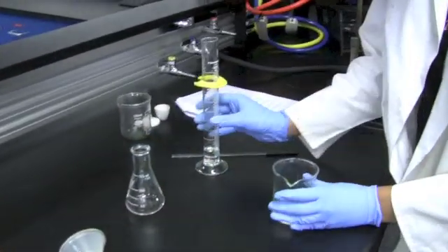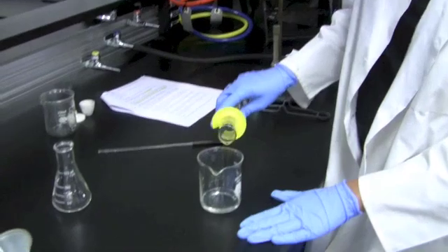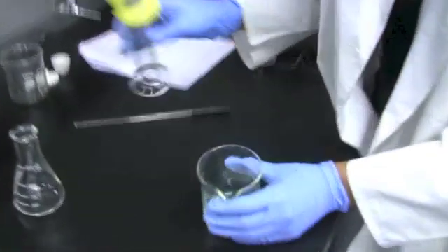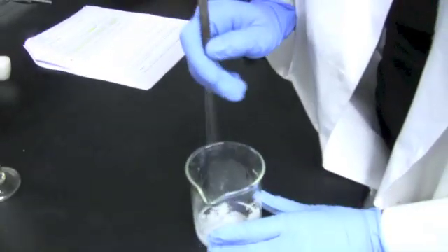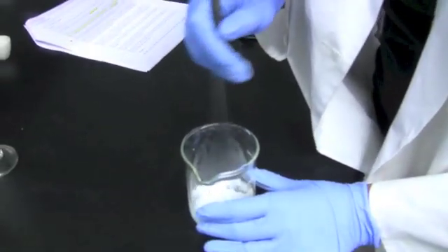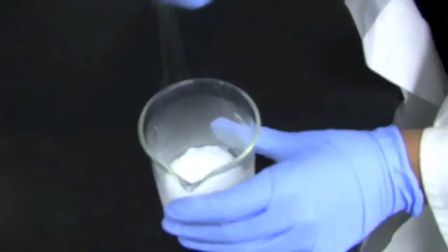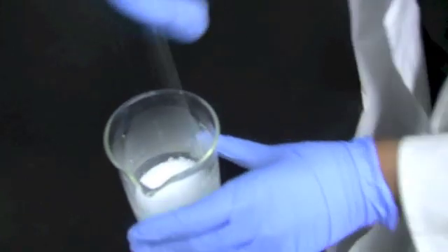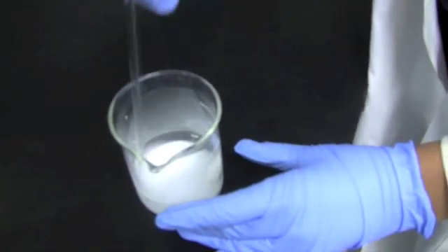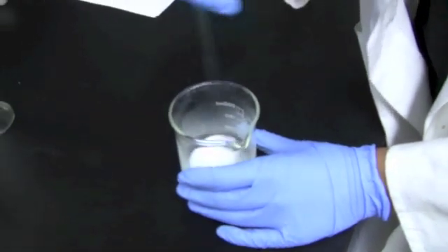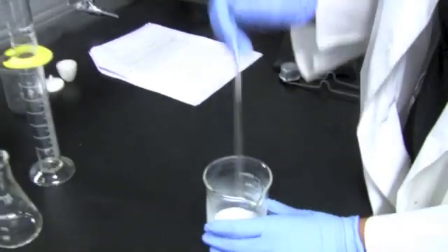Once you do that, you're going to add the 15 milliliters of the sulfuric acid slowly to the beaker and the solution, and you're going to see white precipitate forming like this. However, if you stir, it's going to become even thicker, and eventually it's going to dissolve. Now you should be doing this for a few minutes. And if you still have a lot of precipitate forming, you need to heat it. And you're going to need to continue to heat it until you have 25 milliliters of solution remaining.